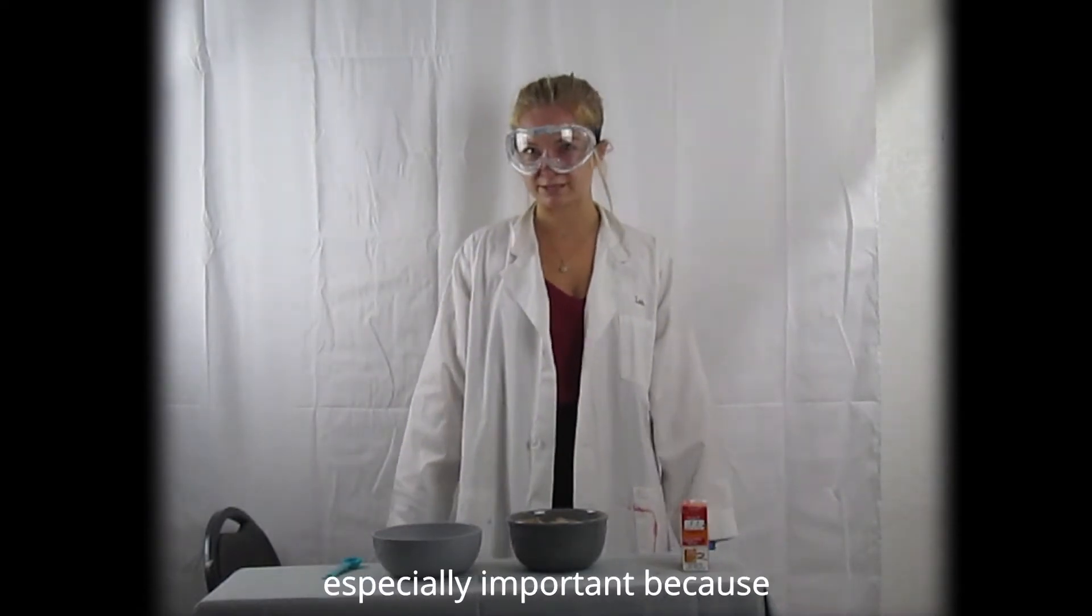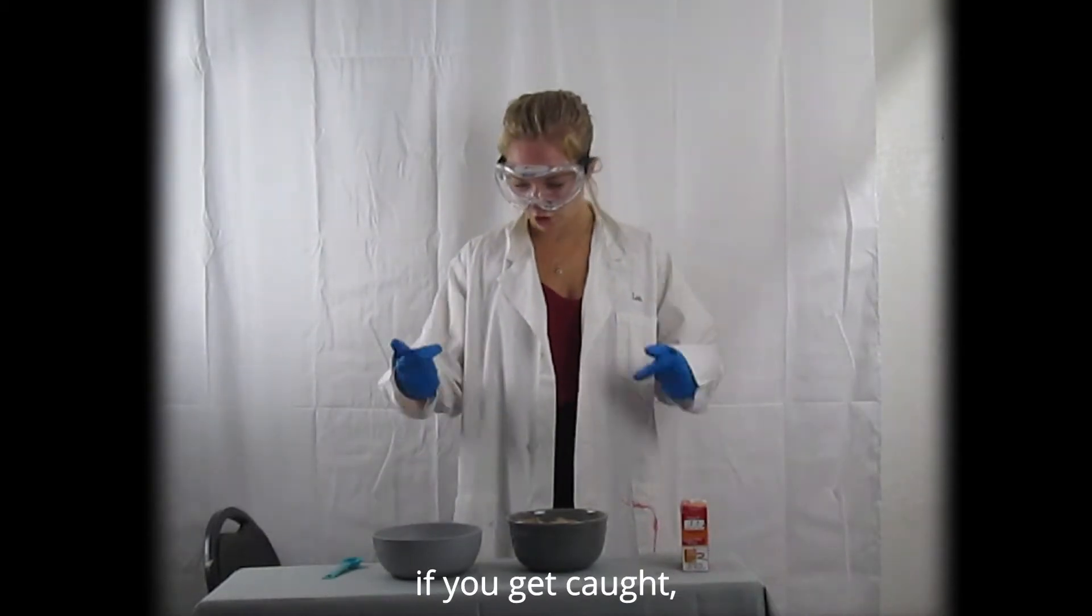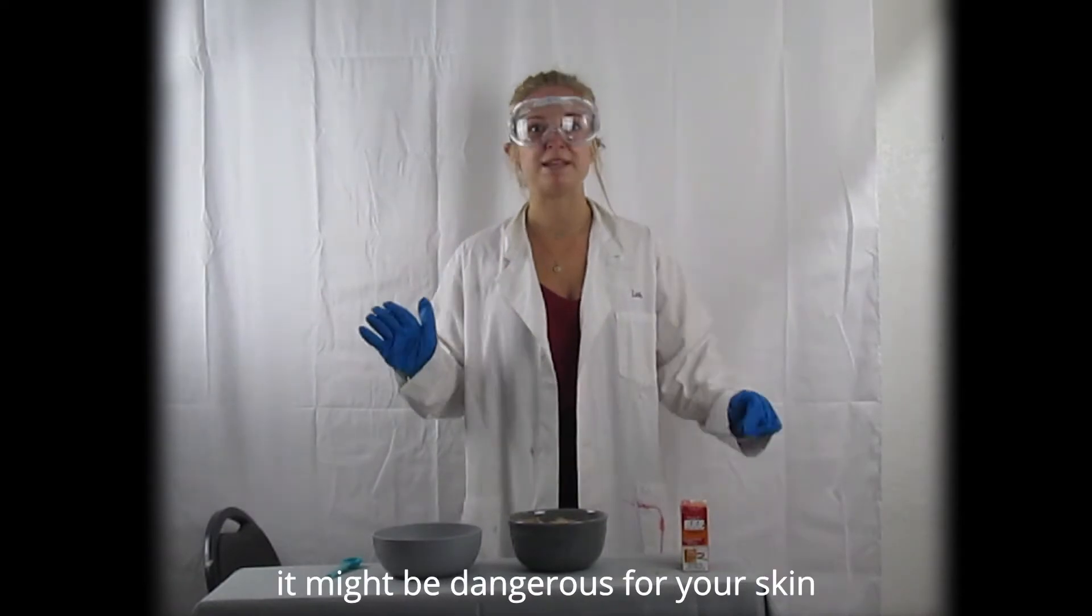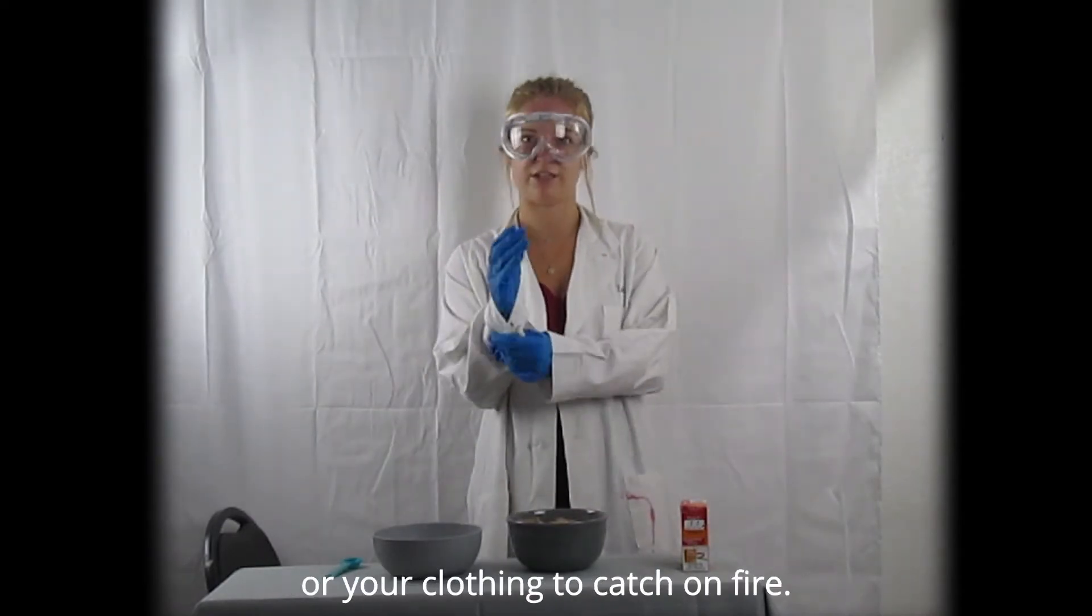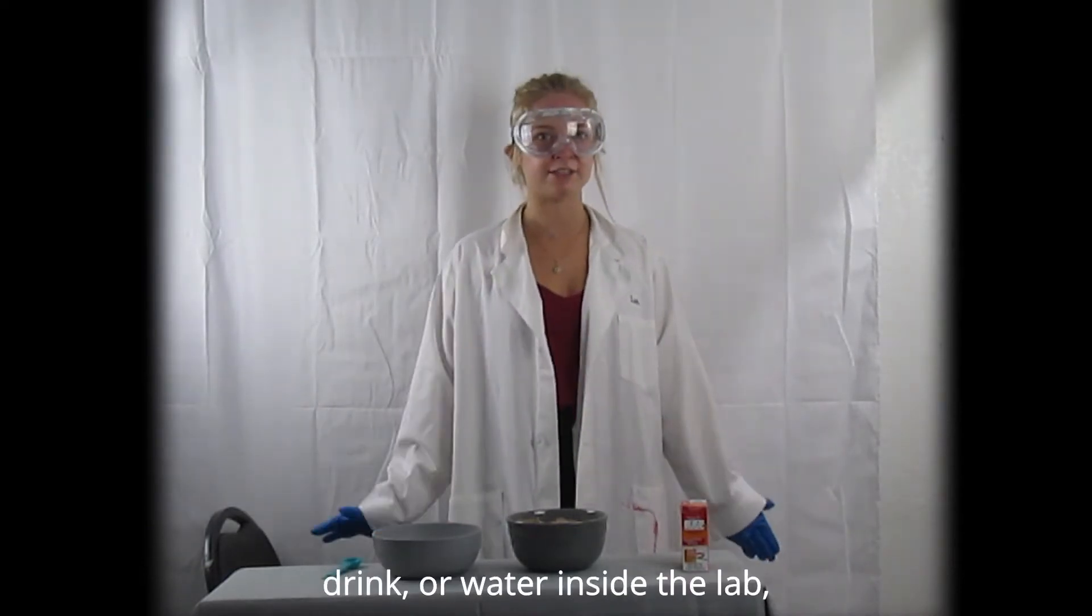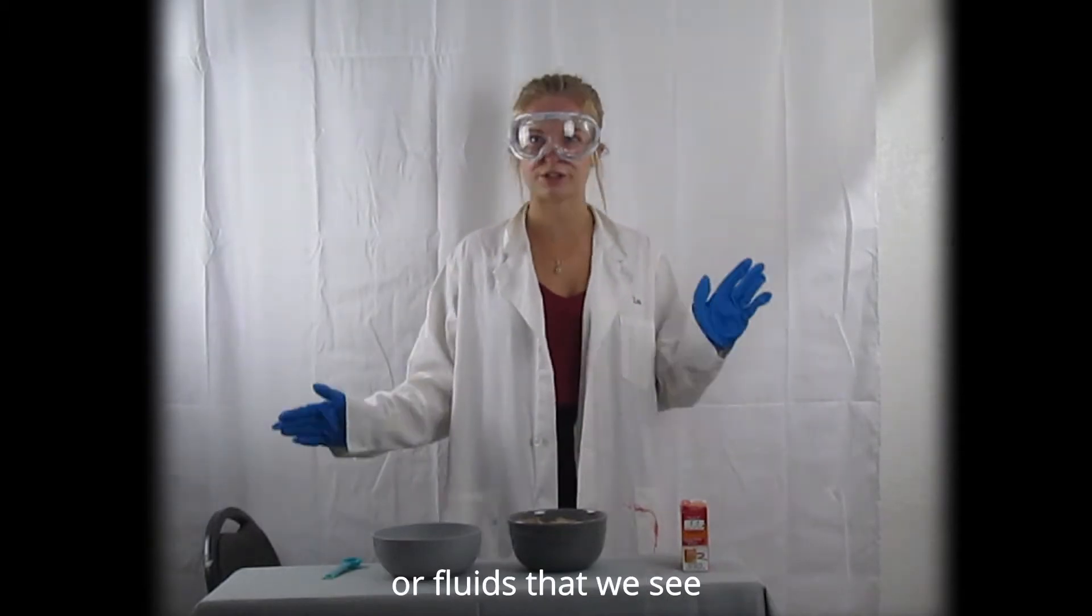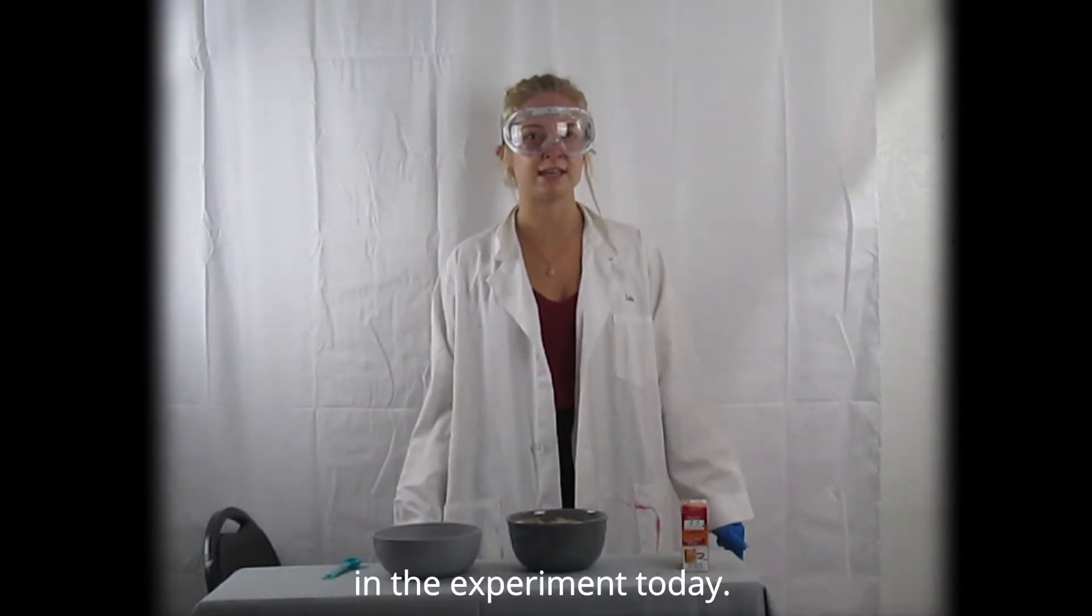Today, that's going to be especially important because we're going to be working with flammable substances that if you get caught or if you touch anything, it might be dangerous for your skin or your clothing to catch on fire. Let's also make sure that we don't have any food, drink, or water inside the lab and that we're not ingesting any of the dangerous chemicals or fluids that we see in the experiment today.